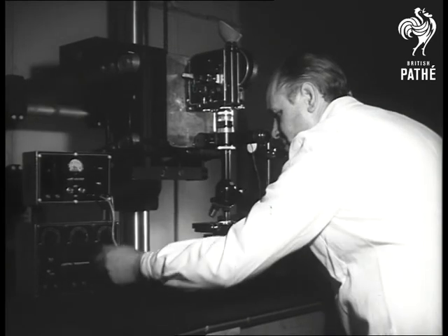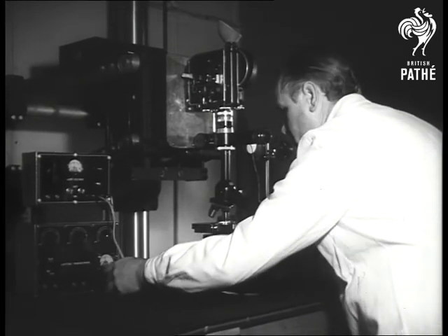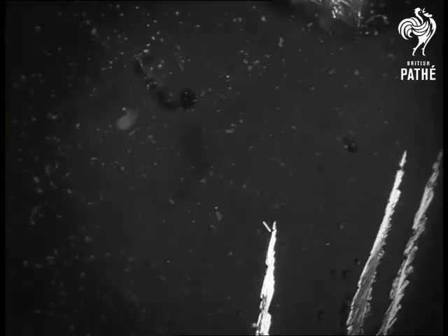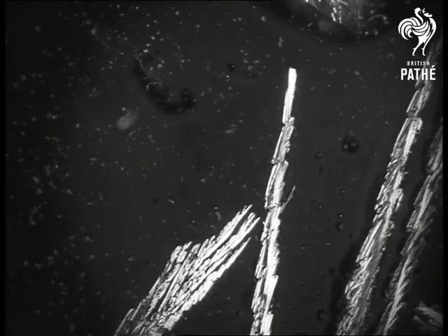Science has progressed tremendously in the last 300 years. The modern microscope, now linked with motion picture photography, is another step on the long road of research.